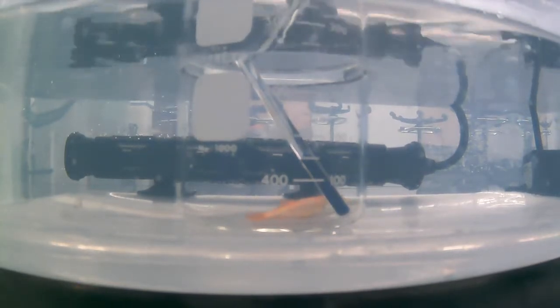Okay, so we've had the opportunity now to run two different treatment groups of goldfish. One at a lower temperature, one at a higher temperature, but occurring within 24 hours of the first measure. Now these were independent samples, so it's not the same fish that went into each trial.